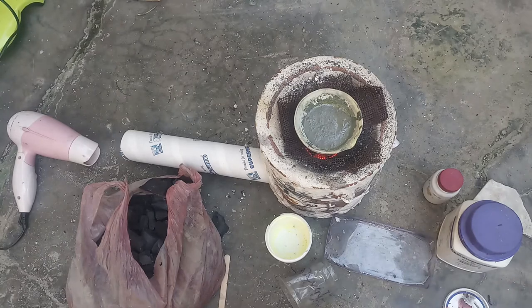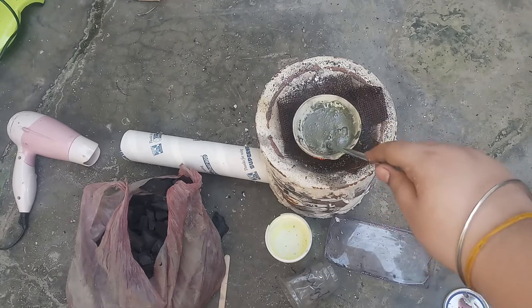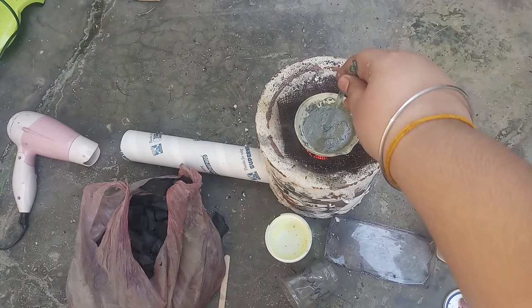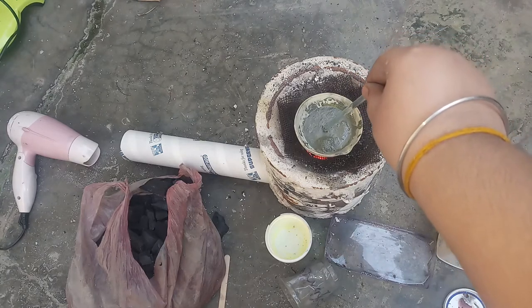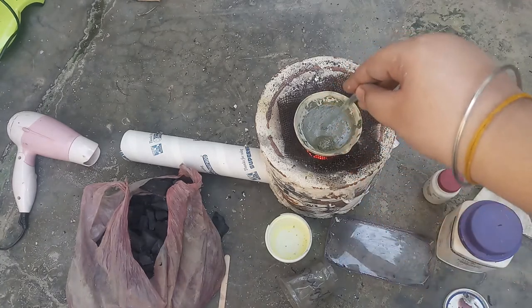Sulfur dioxide has the property of being very toxic — it is usually found in crackers. I am going to try this reaction; I am doing this for the very first time, so keep a glass rod between the mix. The reaction is zinc plus sulfur plus copper. Some of the atoms are displaced by copper, so this produces zinc sulfide.